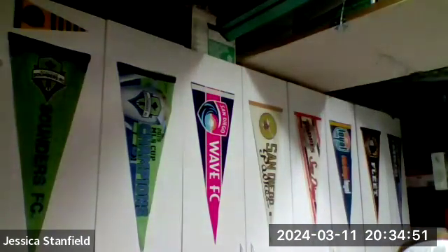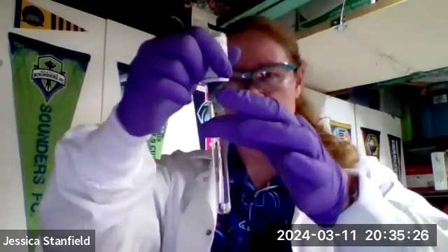In fact, let me grab one more test tube. Oh, and let me grab a different kind of indicator. There we go. So I'm going to grab something called universal indicator. Universal indicator is actually supposed to go through a little bit more of a series of color changes as the pH changes. So add in some more hydrochloric acid. So sometimes our evidence for a chemical change, we can't really see it. And so we have to do something else, like add an indicator in order to see that evidence of a chemical change. Okay, so I've added my universal indicator.